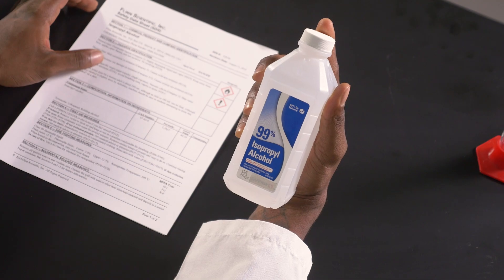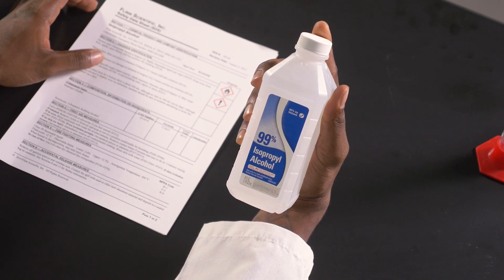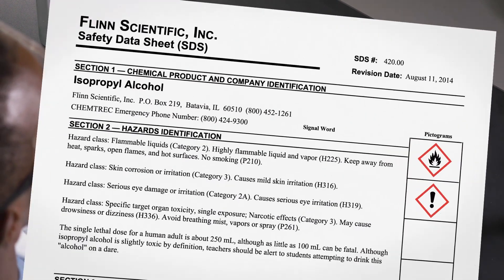In this video, we'll look at a sample SDS for isopropyl alcohol, a common household chemical. Isopropyl alcohol can be found in home first aid kits and is used to treat minor scrapes, cuts, and wounds. So without further ado, let's take a look at a sample SDS.